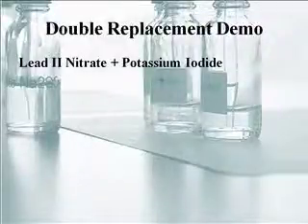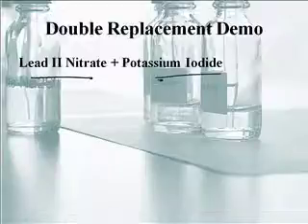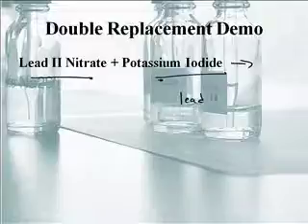There you go, Mr. Sams. That was cool. So this is the reaction, lead(II) nitrate plus potassium iodide, and it formed lead(II) iodide and potassium nitrate.